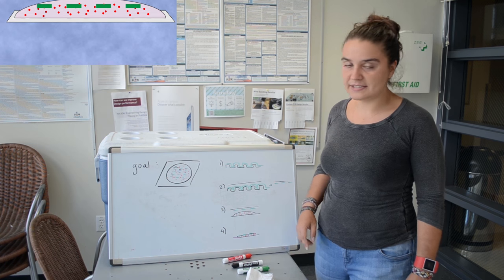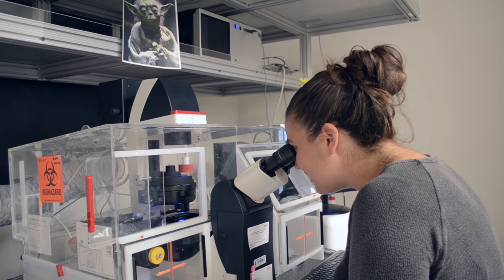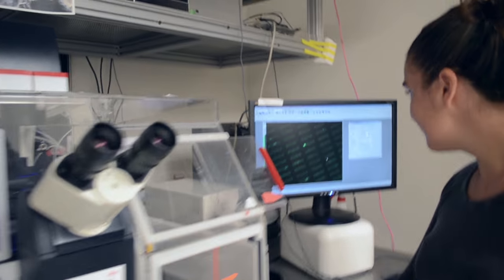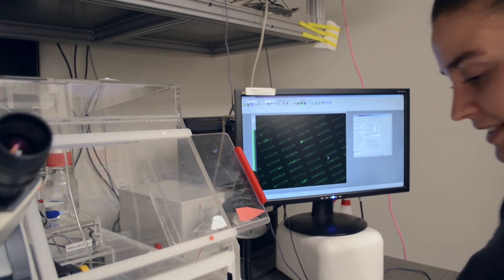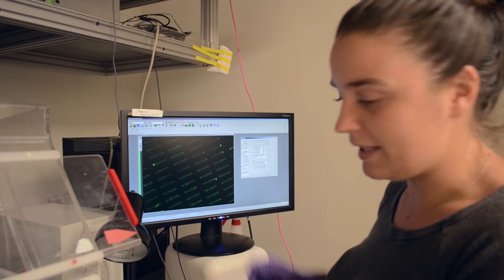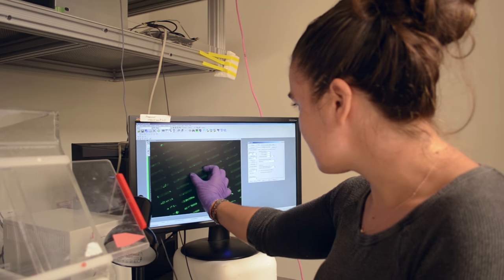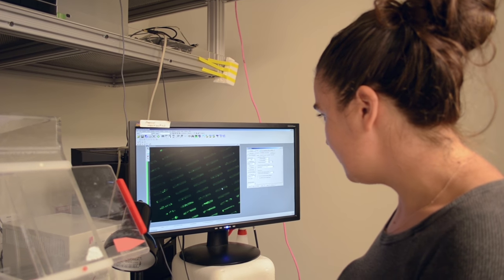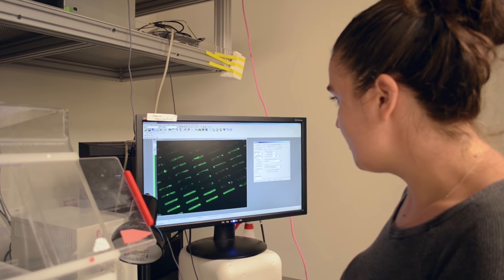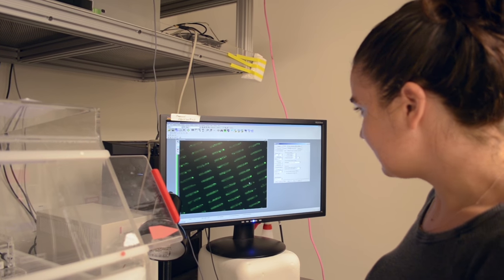And again, this gel has little red beads so we can track its motion. Are you ready? I'm ready. So exciting. You can see the resolution for these, with the stamping, is pretty acceptable. So we're going to get little heart muscle cells to bind, hopefully just one cell. You can see there's some defects here, but there are so many of these patterns on the glass. There's plenty there.